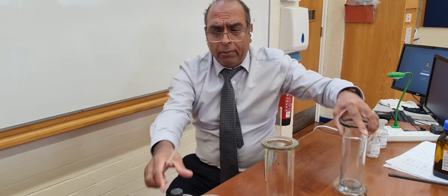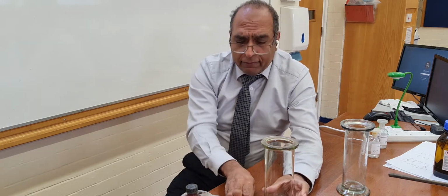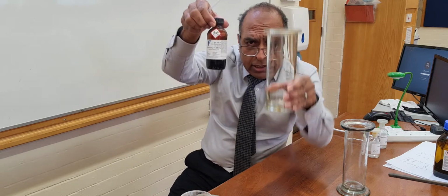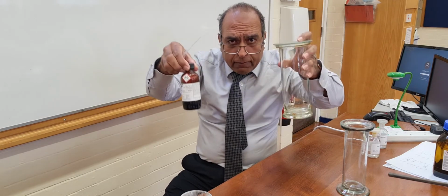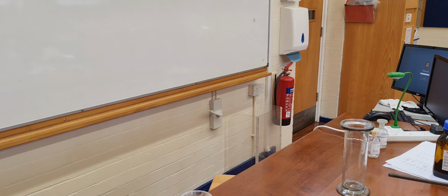Now, the problem is, how do I get the drops into there? I need a fume cupboard, and I've got a fume cupboard over there. I'm just going to put a drop of that into there, put the lid on. I'm going to do that inside the fume cupboard, and I'm going to come back. Just give me a few seconds. Right, I'm over to the fume cupboard. I am putting a few drops in, turn the fume cupboard on.